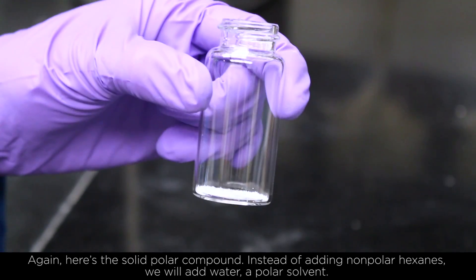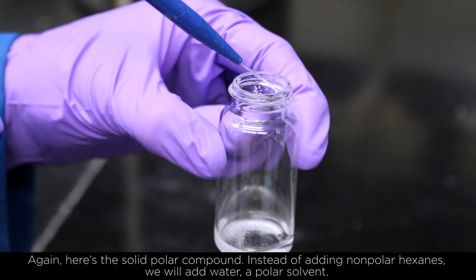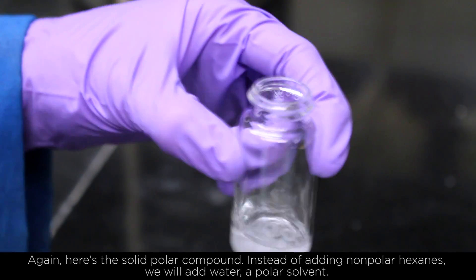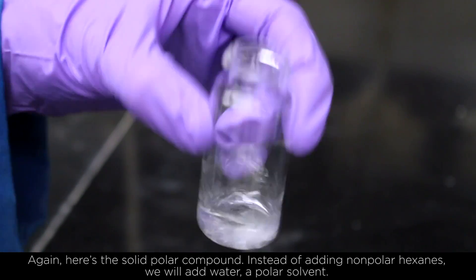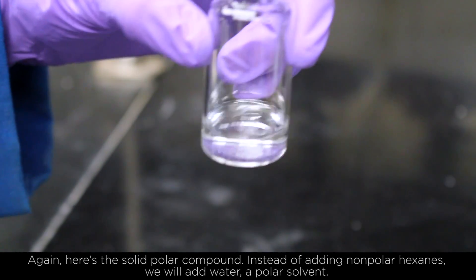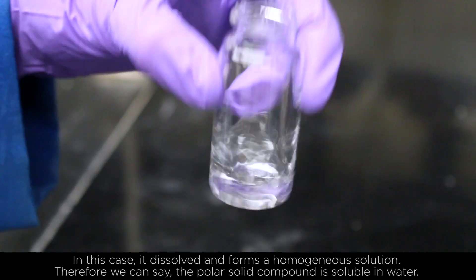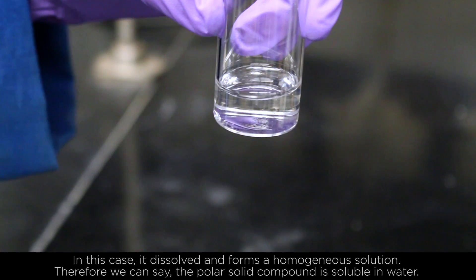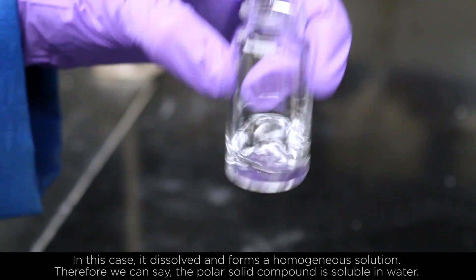Again, here's the solid polar compound. Instead of adding non-polar hexanes, we will add water, a polar solvent. In this case, it dissolves and forms a homogeneous solution. Therefore, we can say the polar solid compound is soluble in water.